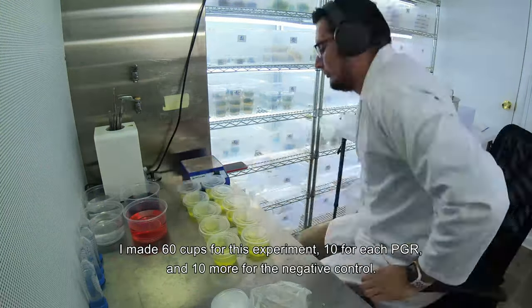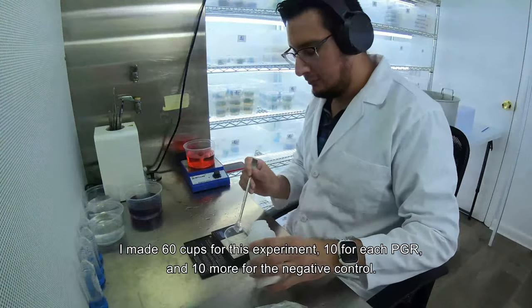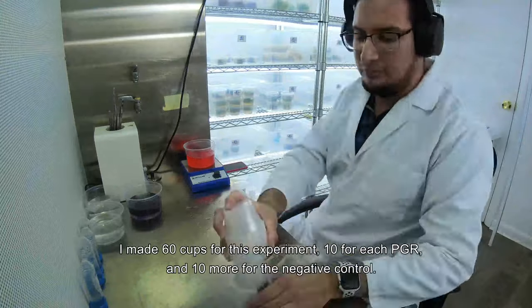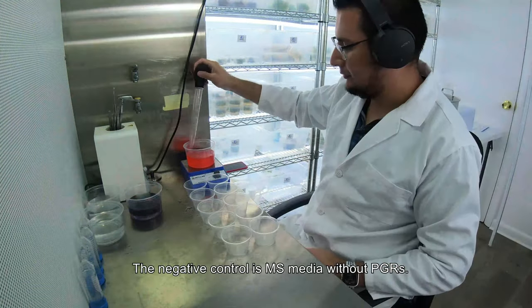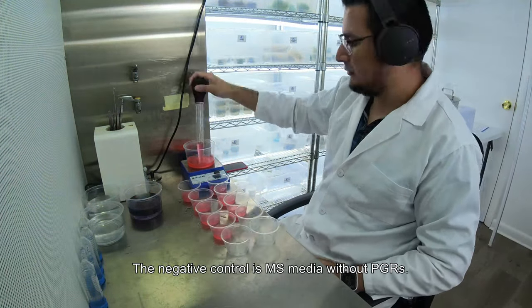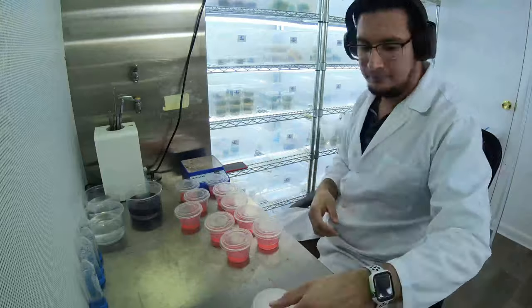I made 60 cups for this experiment — 10 for each PGR and 10 more for the negative control. The negative control is MS media with no PGRs.